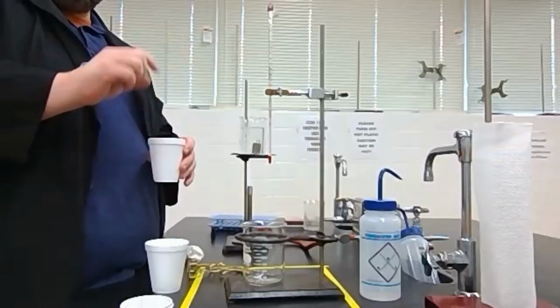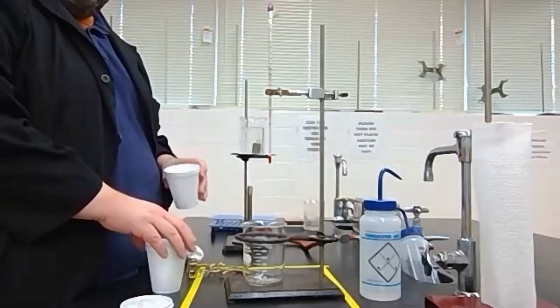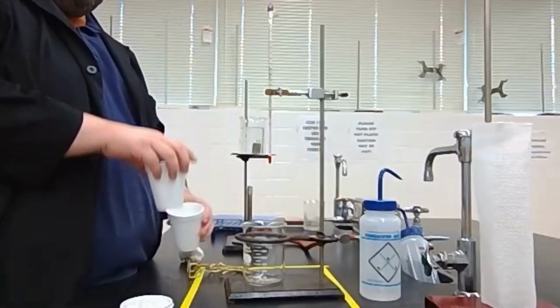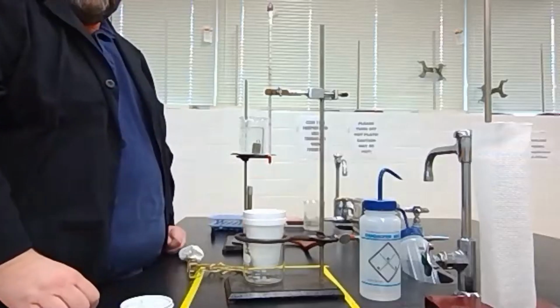We also have air, which is an insulator, and then the glass. Essentially we're creating an isolated system, or a closed system, depending on who you talk to. And then we'll put our two coffee cups right inside there.